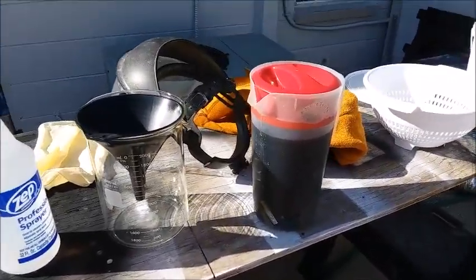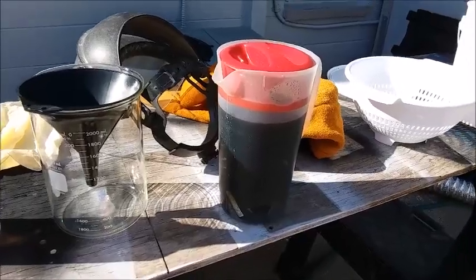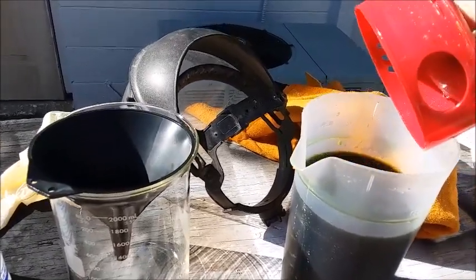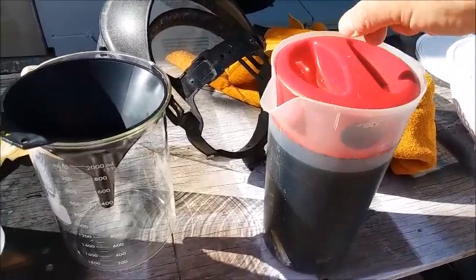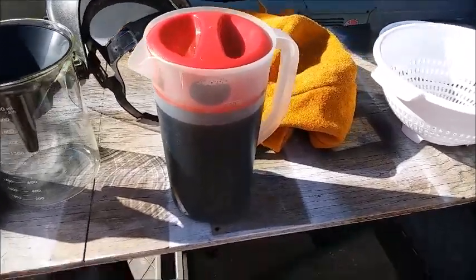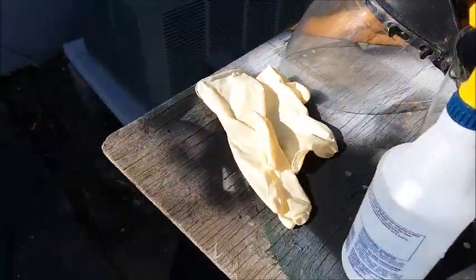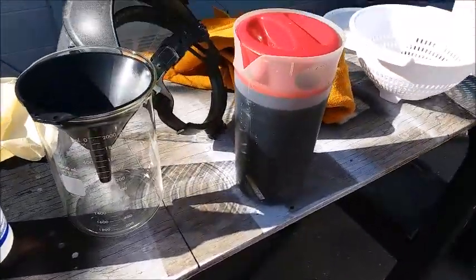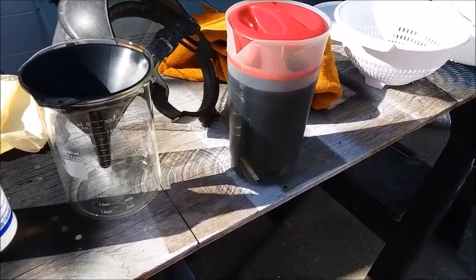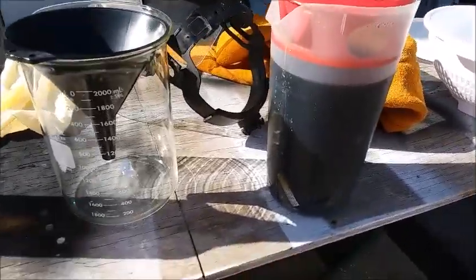It's been a week — actually a little over a week. I had the lid off earlier and it's still fuming a little bit, so there's still some pretty strong acid in there. I need to give the usual disclaimer about wearing personal protective equipment. I'm going to be wearing a leather apron, a face shield, and rubber gloves. I don't want to splash any of this on my skin, get it in my eyes, on my clothes, or on my skin — anything like that.